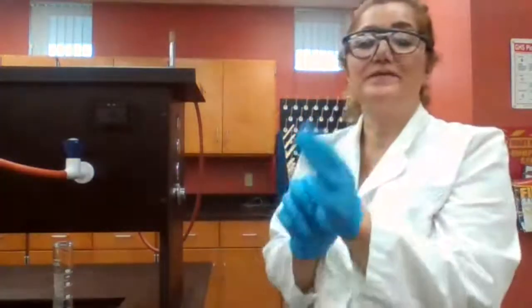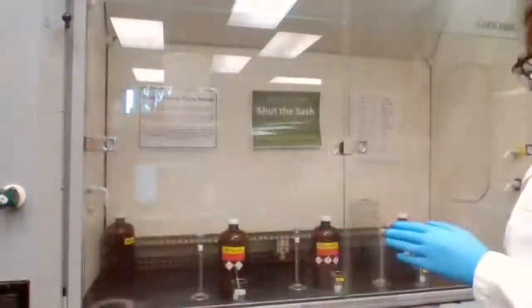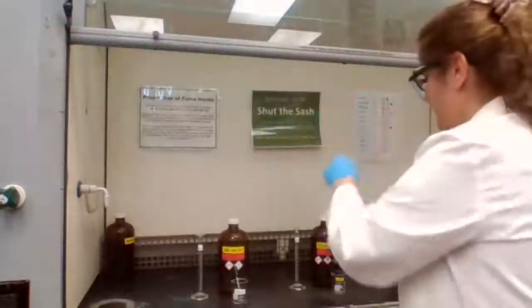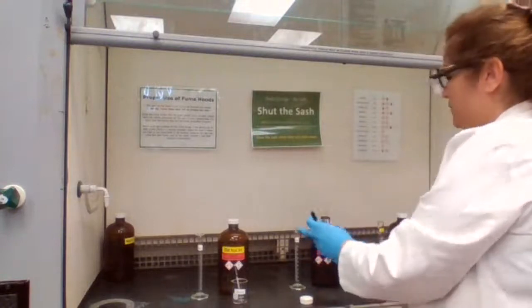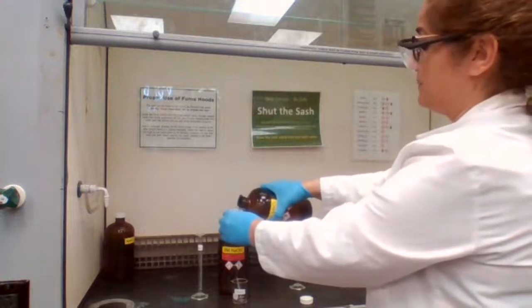And next, I am using my gloves. That means that we are going to work with strong acids. We're going to add HNO3. HNO3 is highly corrosive. It's a very strong acid. And inside the fume hood, we are going to add 5 milliliters of the nitric acid. You see the fumes? I don't know if you could see or not, but these fumes are coming out. It's a very strong acid.